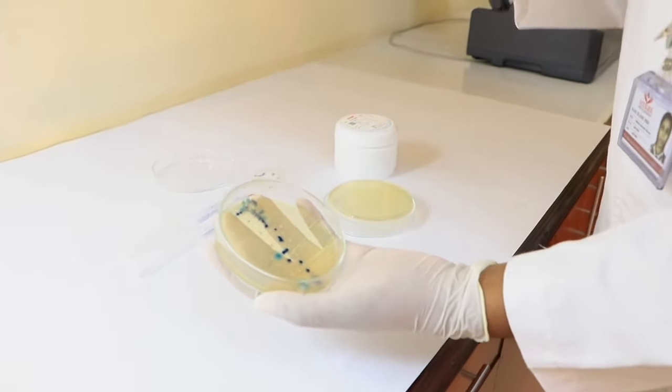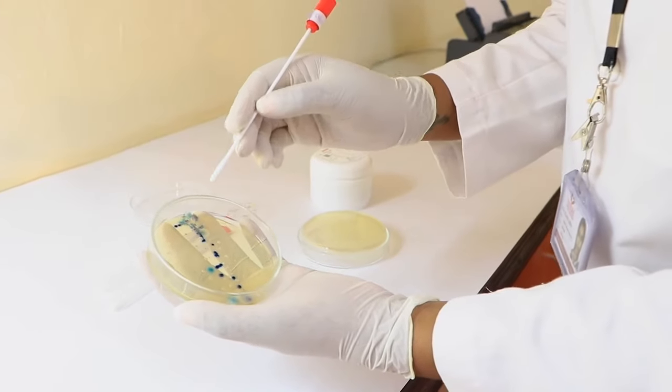To perform the Kirby Bauer Sensitivity Test, take a sterile swab and pick a single colony.